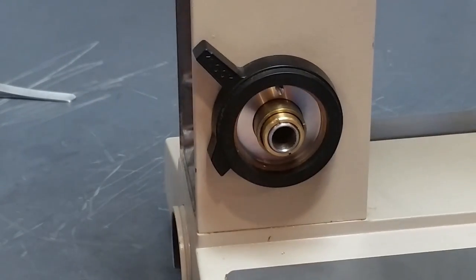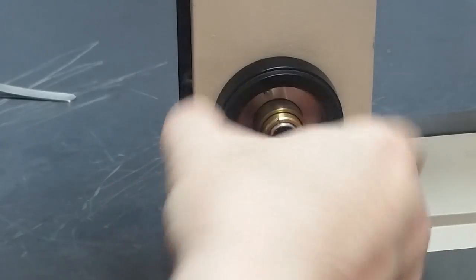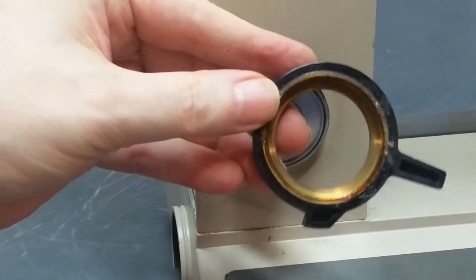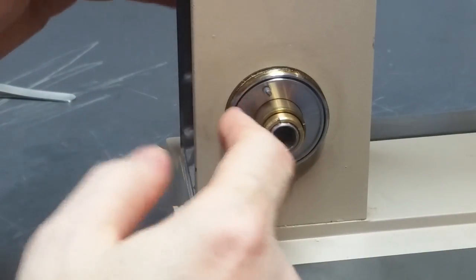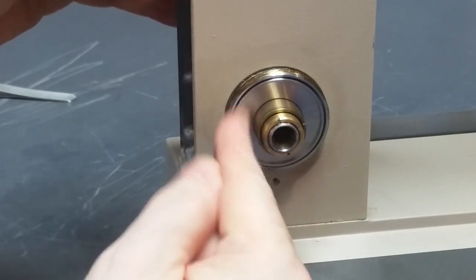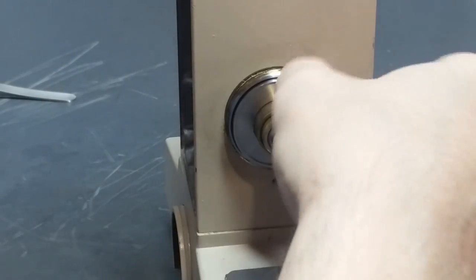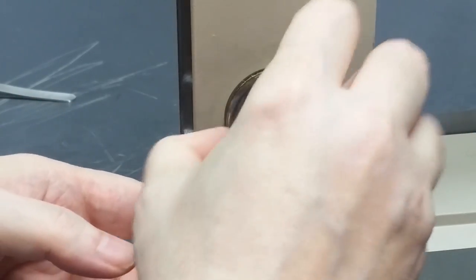And now that stop screw has been removed, this collar, you can unscrew and remove it. Once again, that'll have to be cleaned up pretty well. Now, inside of here is a rotating disc, this little pin on it. You can grasp this pin and work it, you can get this thing to come off.